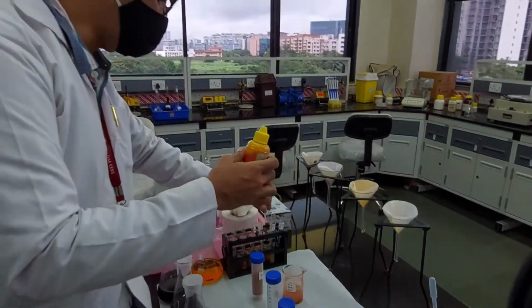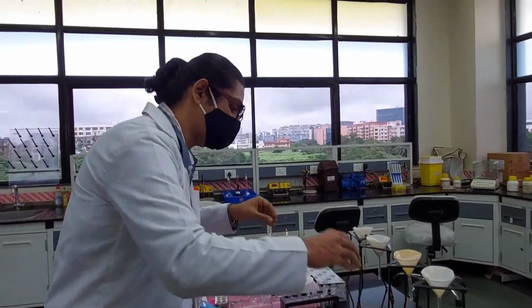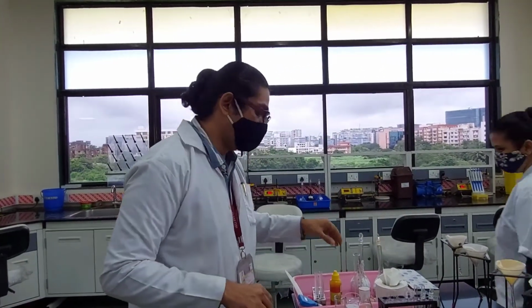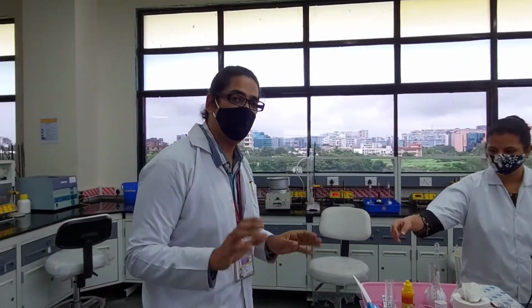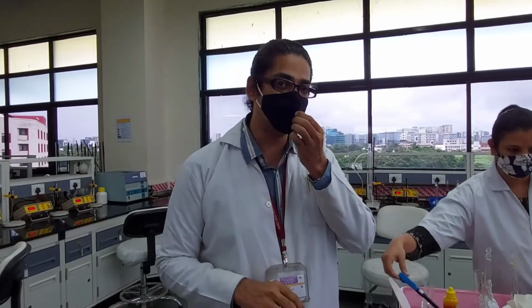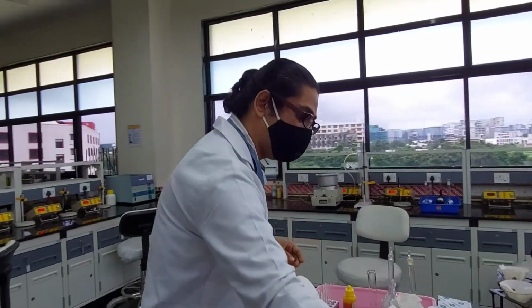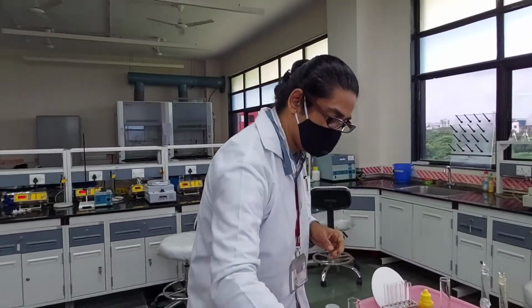So, anyways, we have seen that the pH of the soils can vary depending upon their location. It's very crucial that we have an optimal pH based on the crop we want to grow. The next thing we are going to measure is the conductance. For that we will need those samples again. One sample we already have over here.